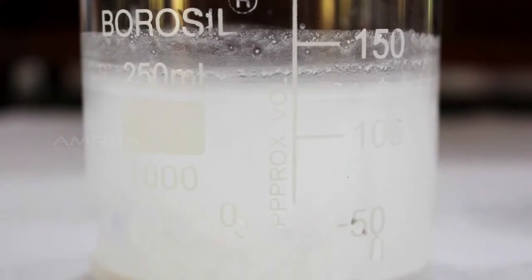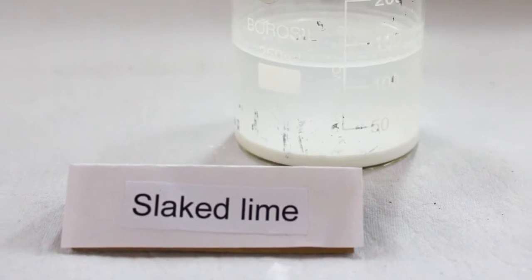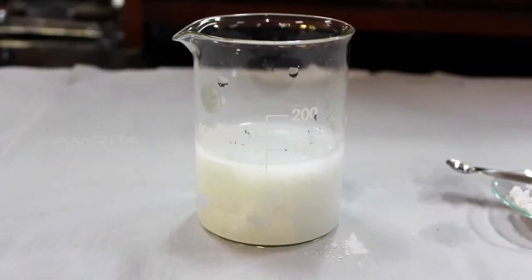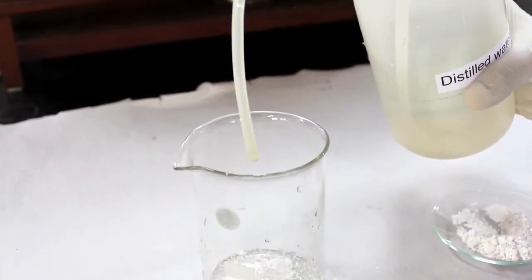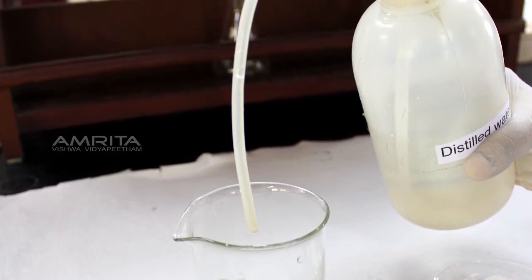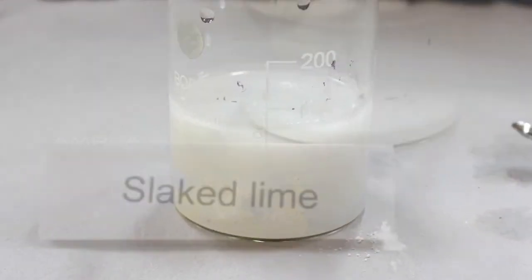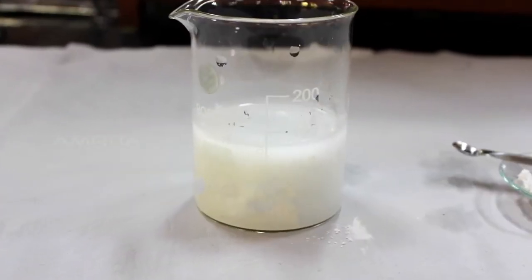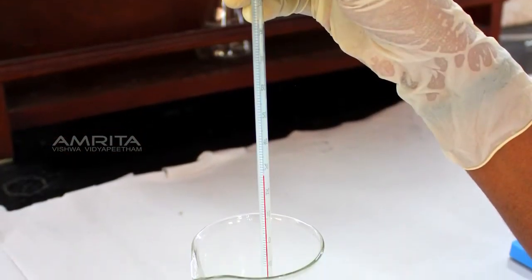Here, quicklime reacts with water and forms a suspension of slaked lime in water. This is a combination reaction as the two reactants, quicklime and water, react to form a single product, calcium hydroxide, that is, slaked lime. This reaction is exothermic in nature as it releases thermal energy in the process.